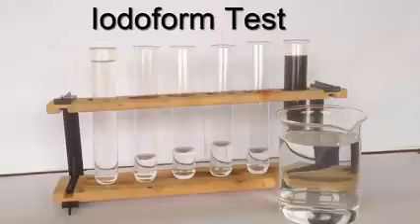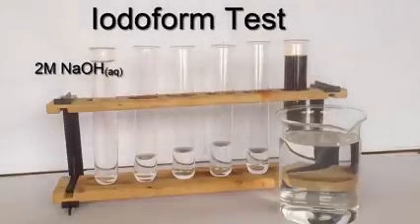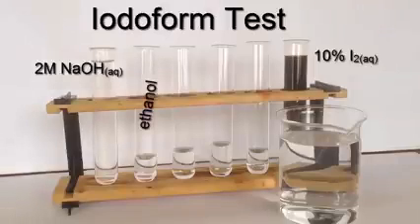In this video, I take a look at the use of the iodoform test for particular types of alcohol. I'm using 2 molar sodium hydroxide solution, which I have in the left-hand boiling tube there, together with a 10% solution of iodine made up in potassium iodide solution.